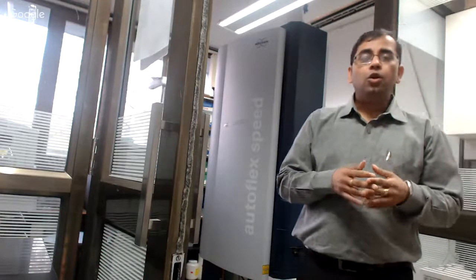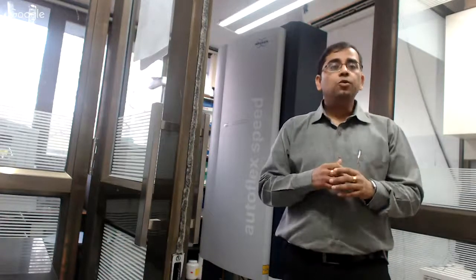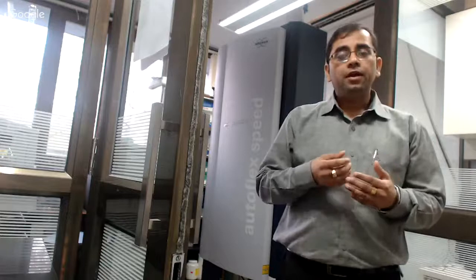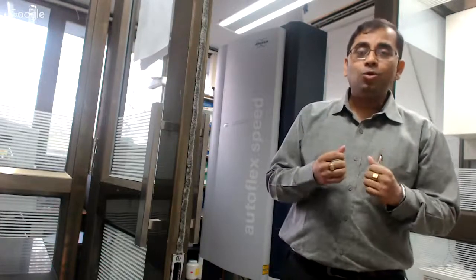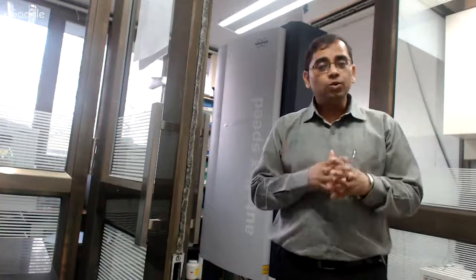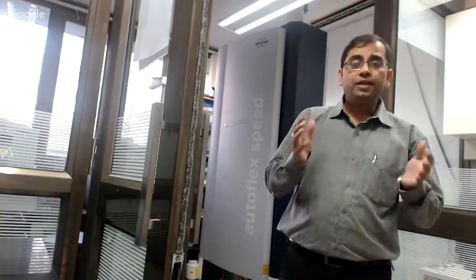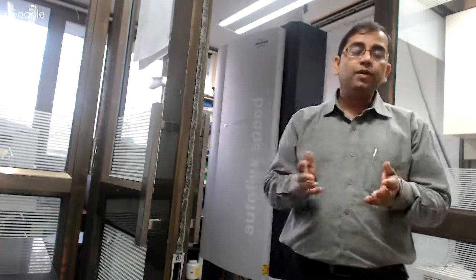Right now mass spectrometry technology is undergoing a lot of revolution, and a lot of changes are happening. You might be hearing that many types of LC-MS platforms are becoming much more robust for doing a lot of proteomic analysis. But I must say that I'm not convinced by those statements, because each instrument has its own unique capability, and it offers very unique applications which you cannot obtain from other instruments. For example, imagine from 2D electrophoresis or an SDS-PAGE gel, you have obtained a lot of bands and spots of interest, and you want to identify all of those proteins very quickly.